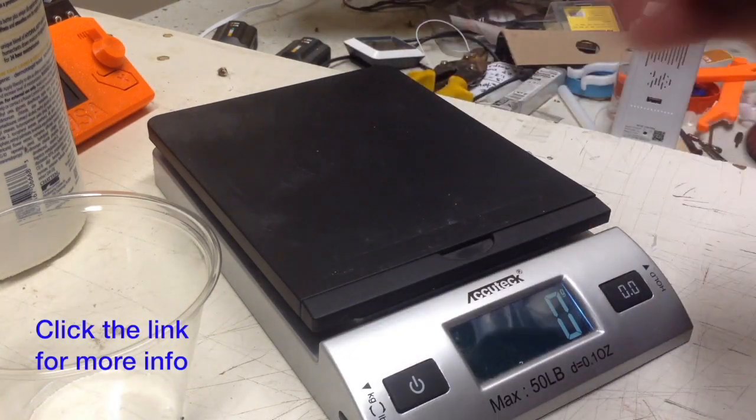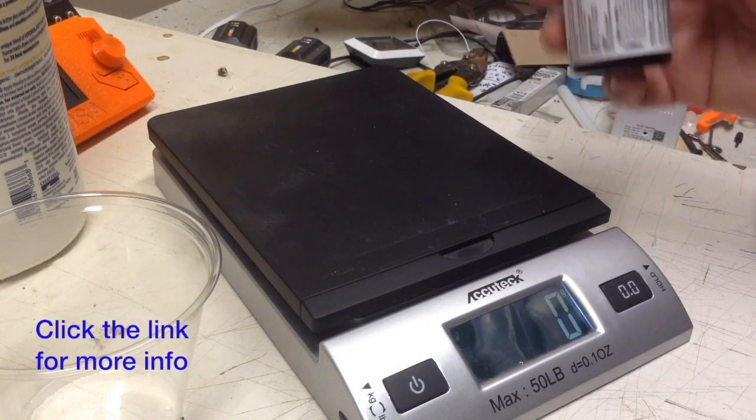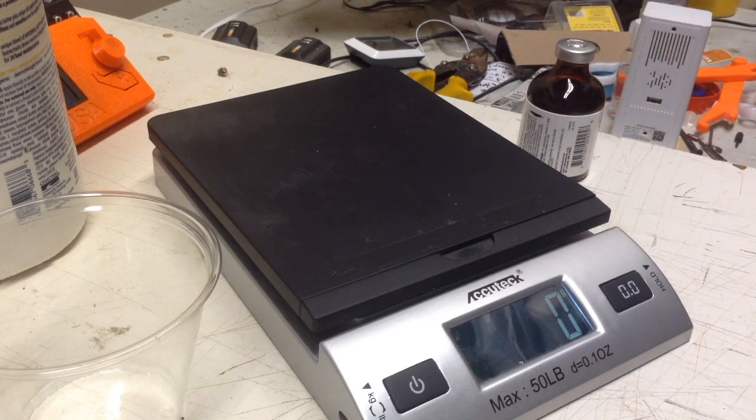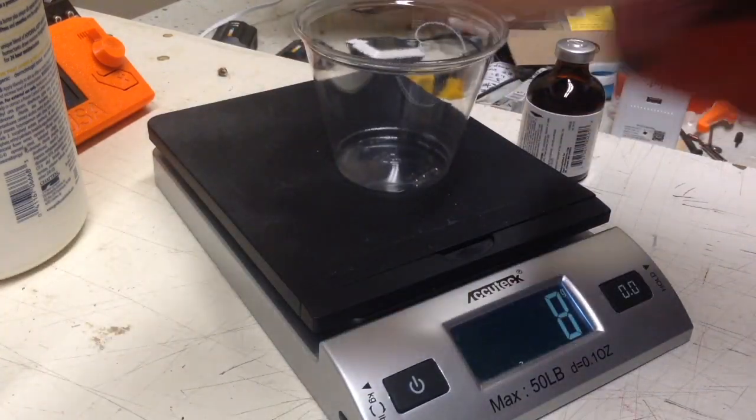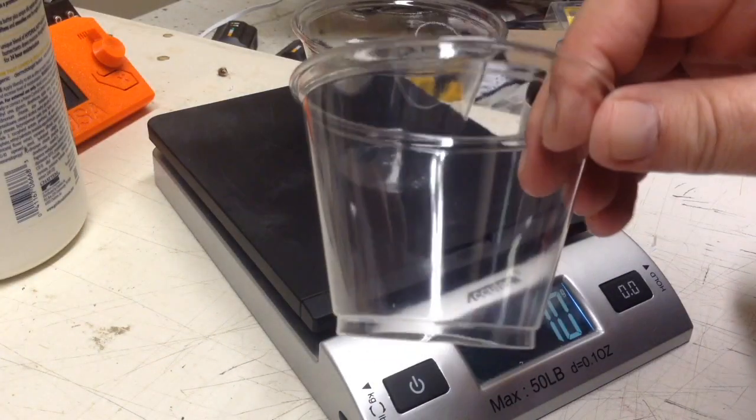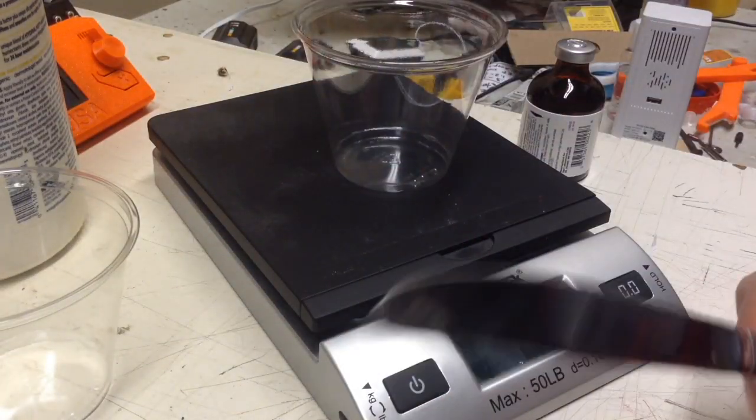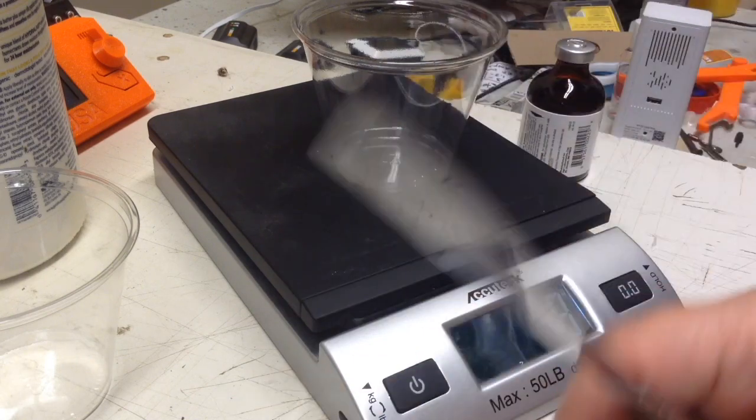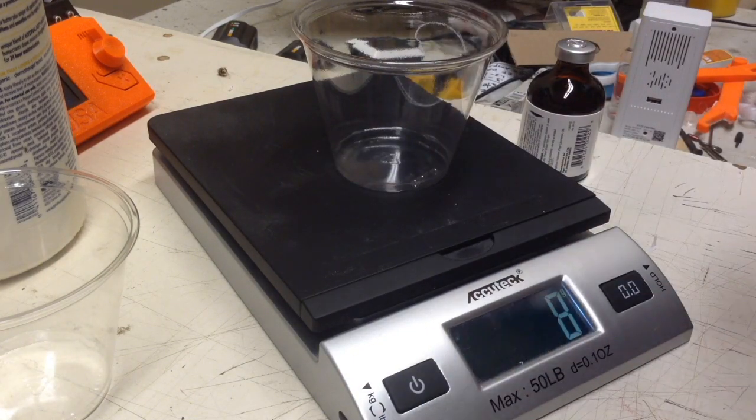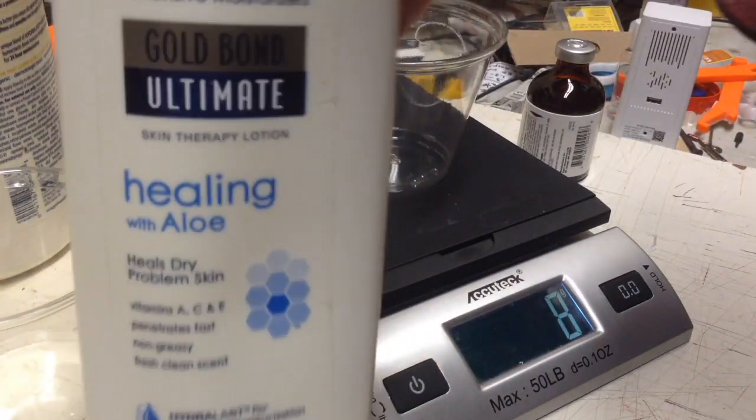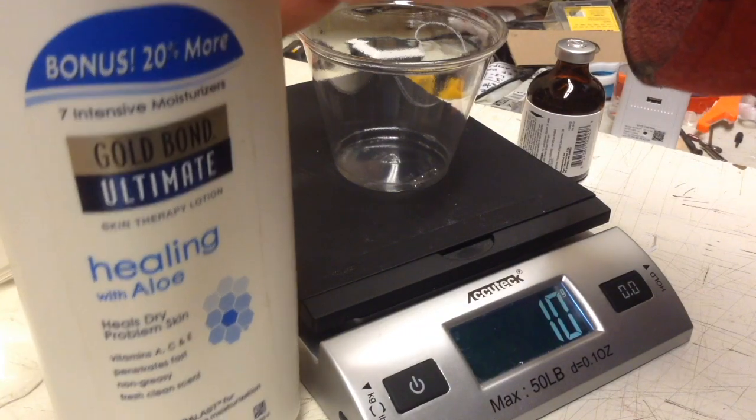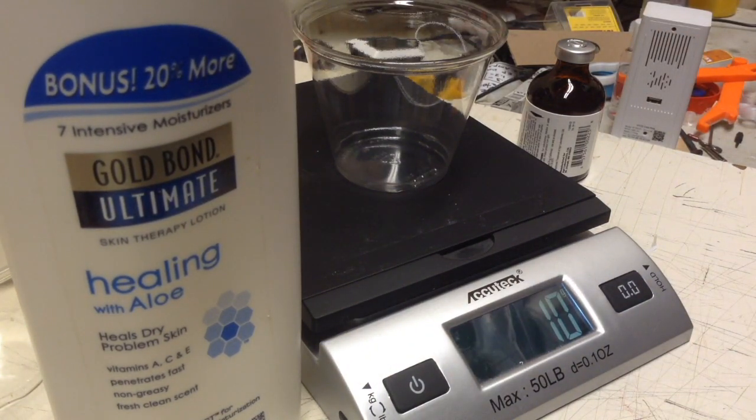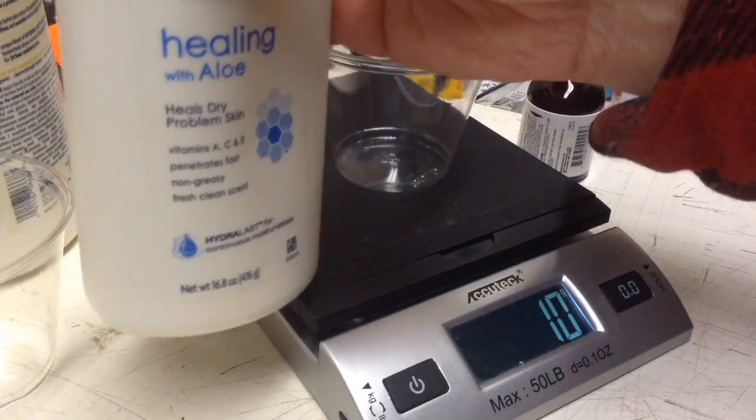I can't show the brand name because I don't want to get sued. I have a couple of cups here, little plastic cups, and some basic utensils for stirring, and then some of my oft-recommended Gold Bond Ultimate Skin Lotion. Why do I use this? Because it's really thick.